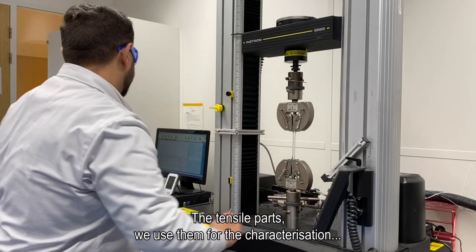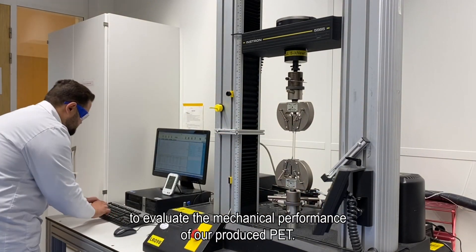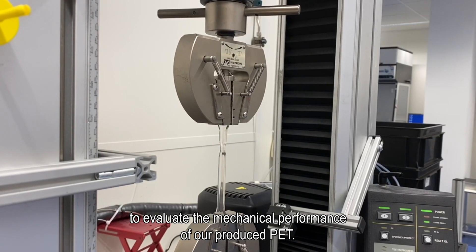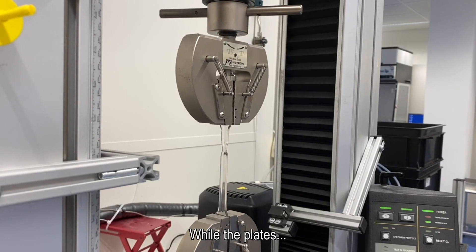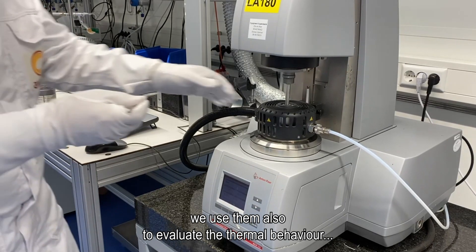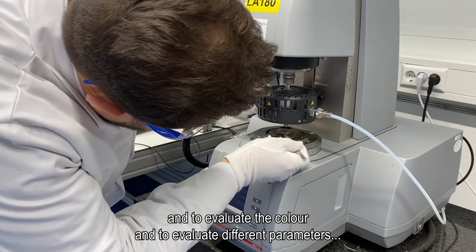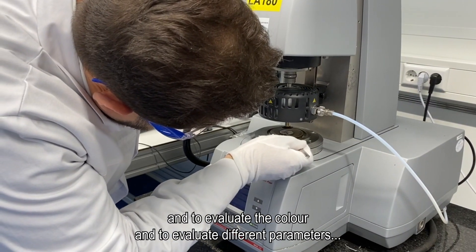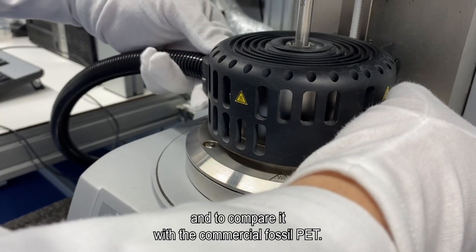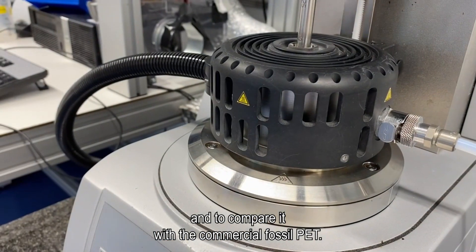The tensile parts we use for characterization, to evaluate the mechanical performance of our produced PET, while the plaques we use to evaluate the thermal behavior, the color, and different parameters for our produced PET, and to compare it with the commercial fossil PET.